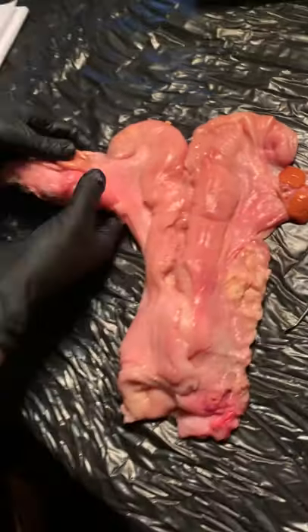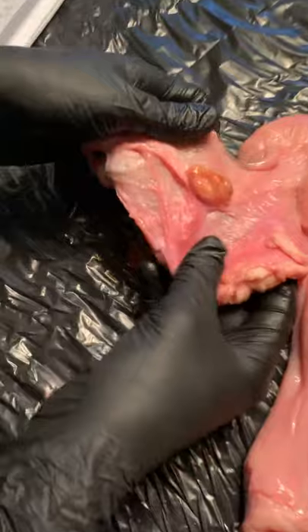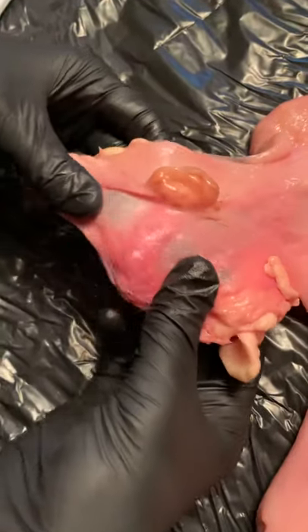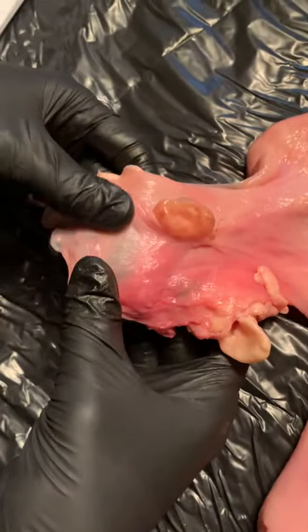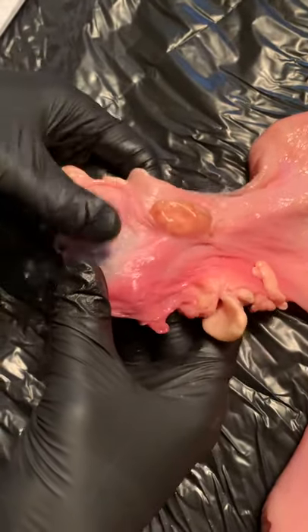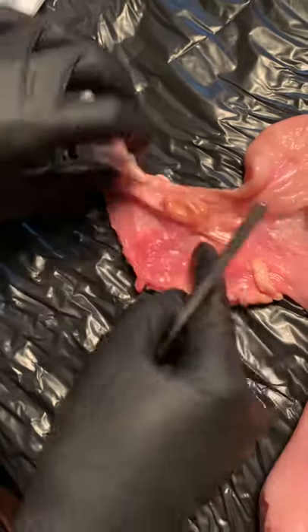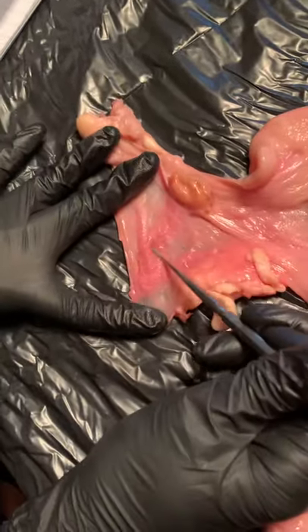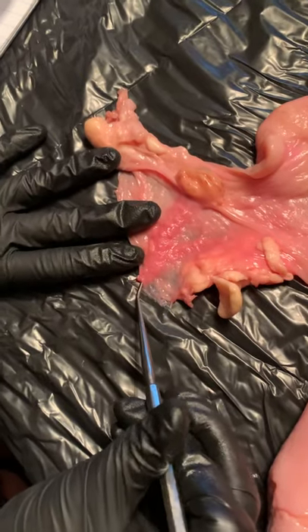Over here is the oviduct, which is responsible for fertilization. This part here is called the fimbria, which catches the egg, and then leads to the infundibulum, which is this large tube right here — the beginning of the oviduct.